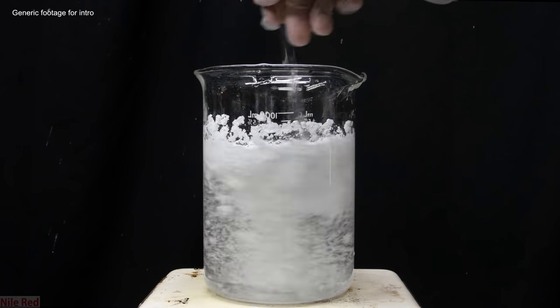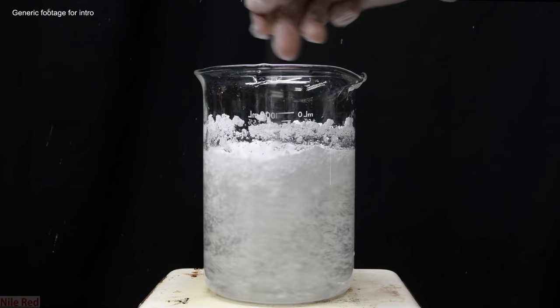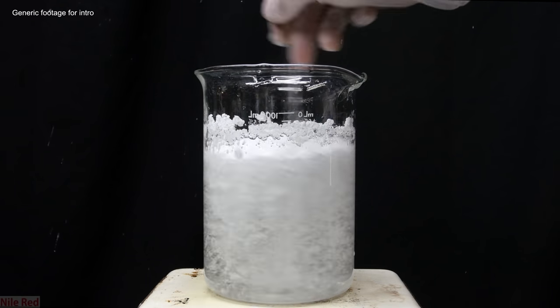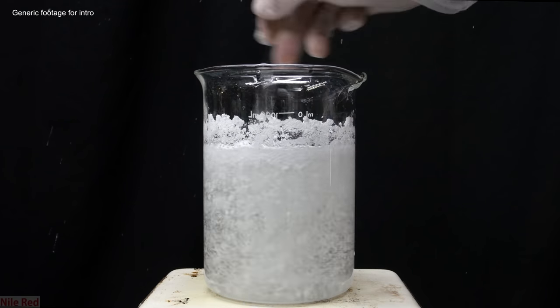The practical aspect for this video will be a basic recrystallization, and maybe in the future I'll go over some more complicated ones practically. Anyway, with that disclaimer, we can move on and start the introduction.